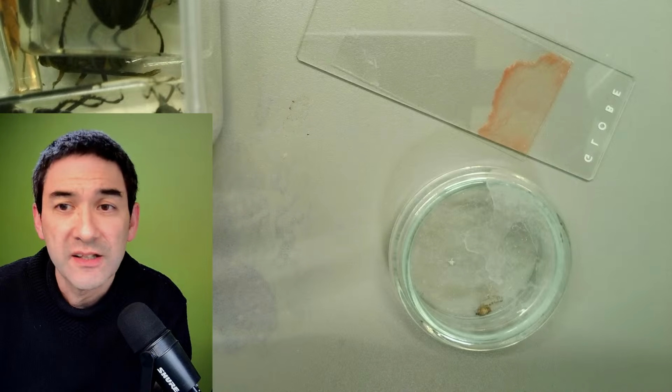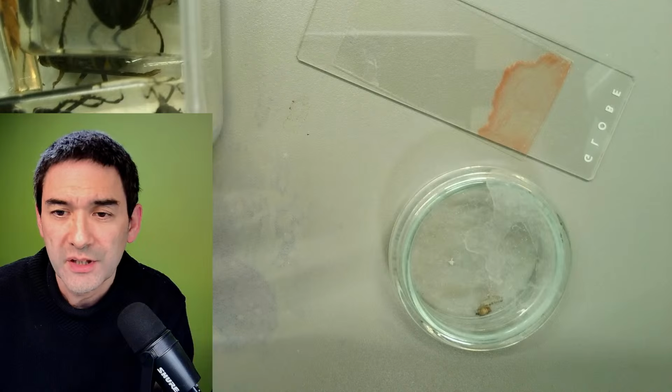I'm surprised that it didn't eat its own skin. Same for me. I also was a little bit surprised.